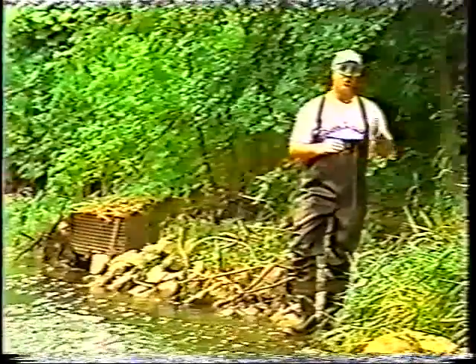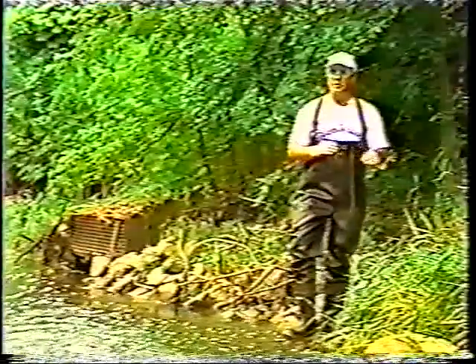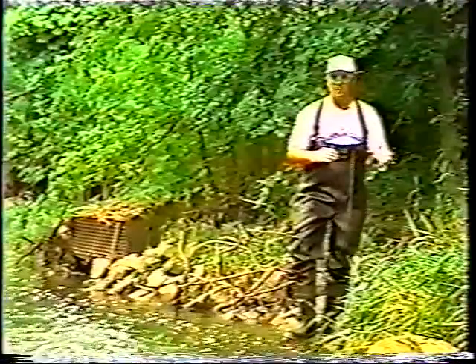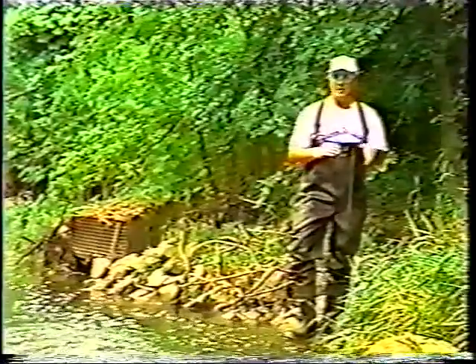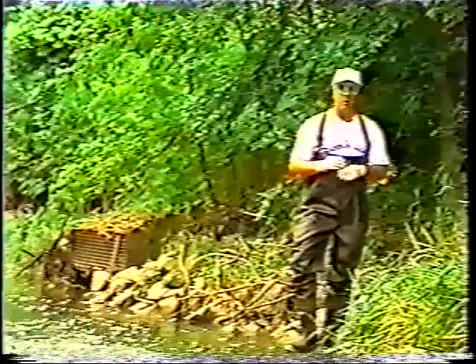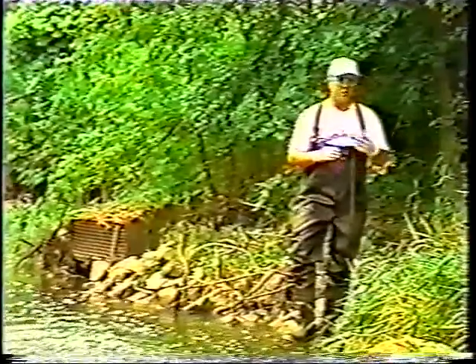What you're looking for is a change in temperature. Any change in temperature within a mile of the stream would indicate that maybe there's some sort of thermal pollution or something's happening to cause a serious change in the temperature. And that will affect your overall water quality when you run your Q value.